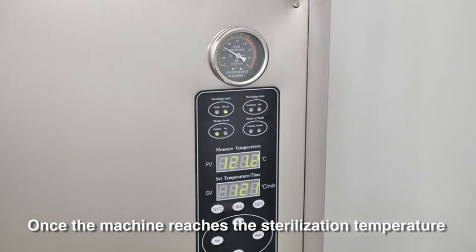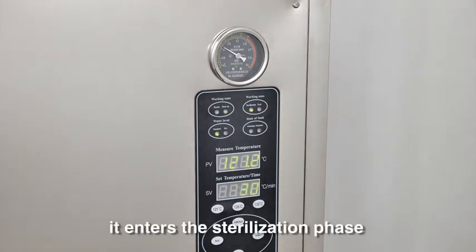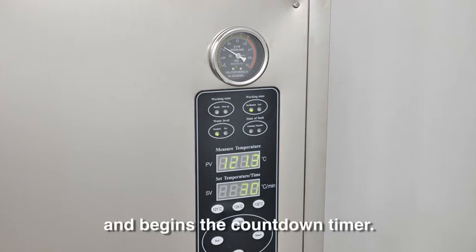Once the machine reaches the sterilization temperature, it enters the sterilization phase and begins the countdown timer.